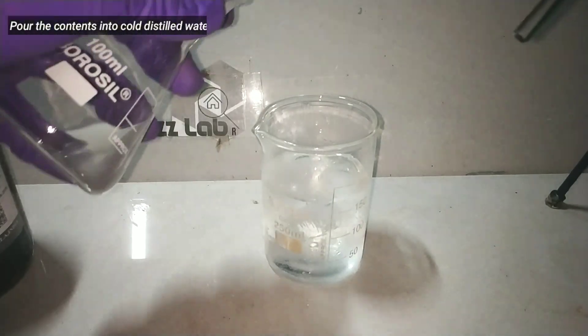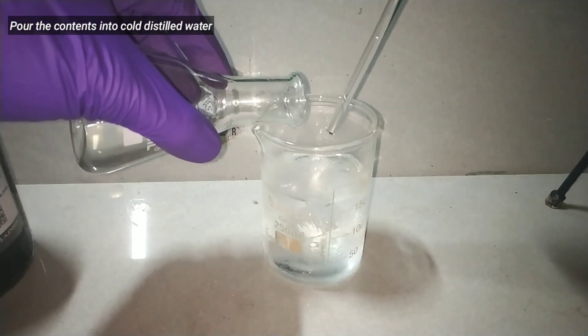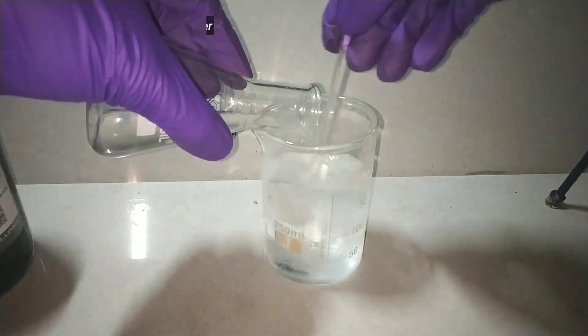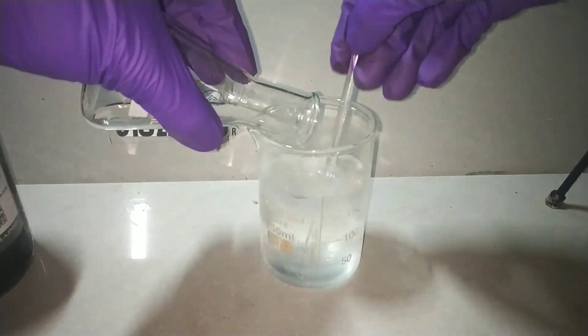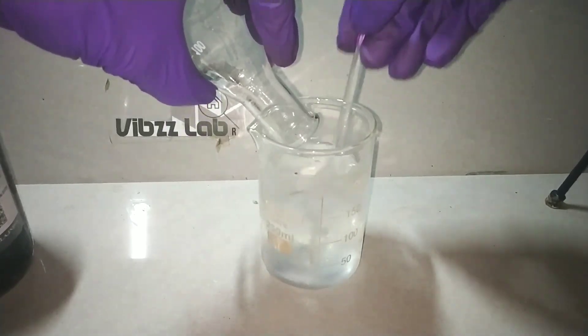Now after 10 minutes of shaking, we pour the contents of the flask into about 180 ml of ice cold distilled water with continuous stirring using the glass stirring rod.